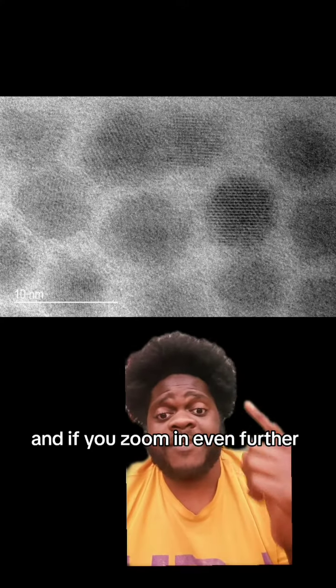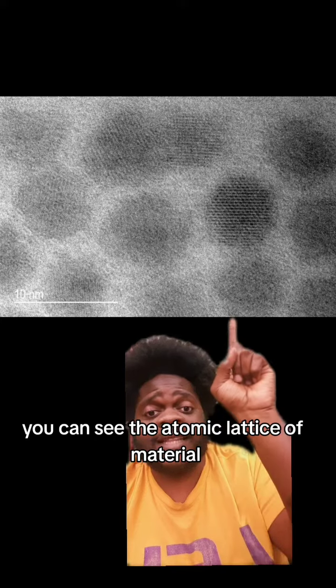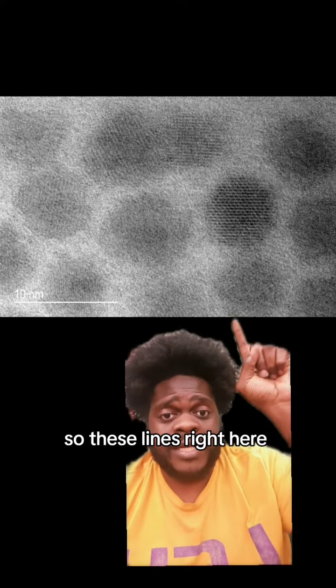And if you zoom in even further, you can see the atomic lattice of the material. So these lines right here, or like here, are the actual crystalline lattice of this material. And since every material has a lattice constant, what I could do is I could measure the spacing between each of these and compare it to known materials and figure out what material this is if I didn't know what it was.